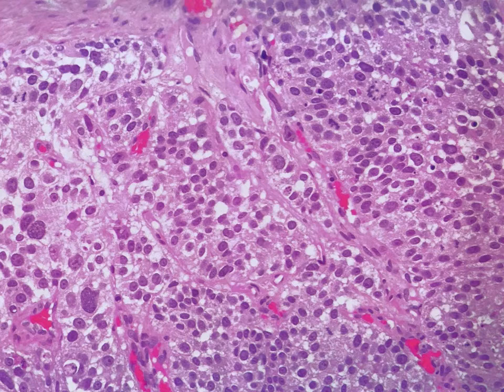Again, in this picture also you can see at this area there are some large irregular nuclei, and the rest is just other tumor cells. They are arranged in big large clusters, or you can say large groups of tumor cells. And this is just to demonstrate to you what a mitosis looks like.